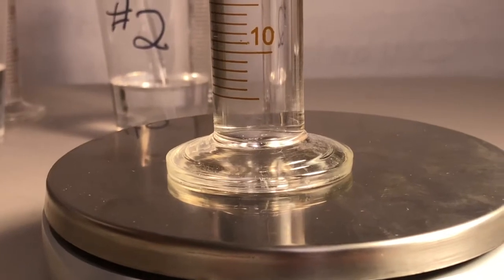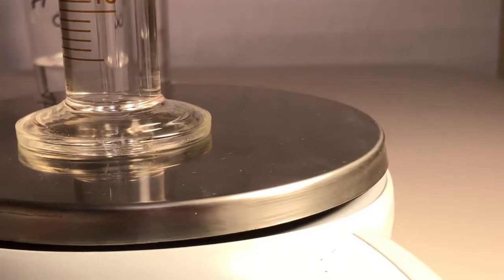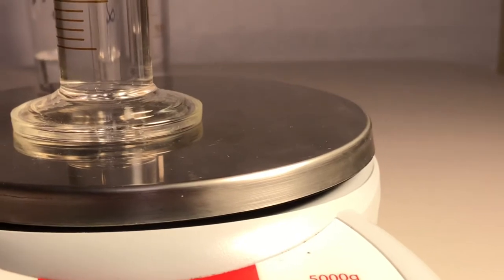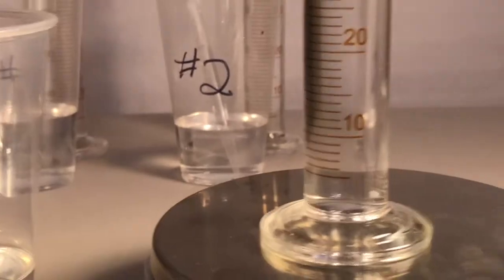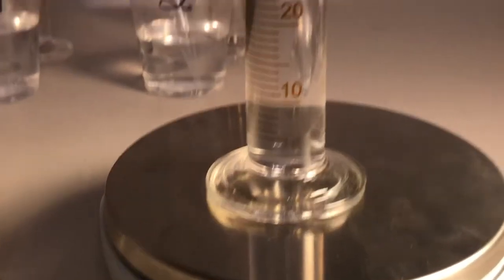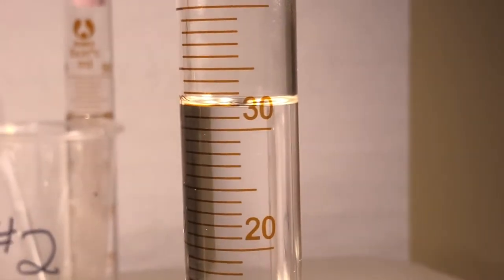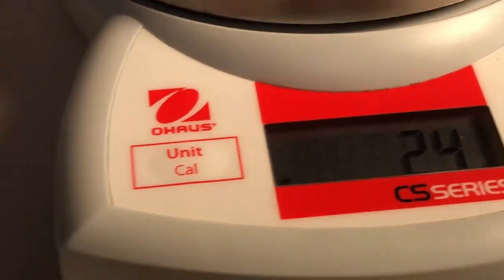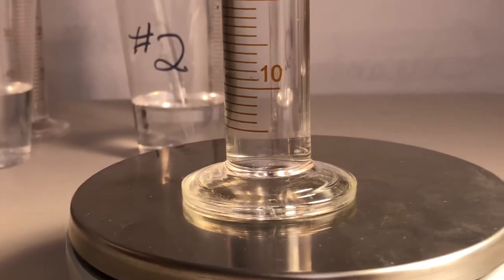That was 5. Here comes 6. Let's do a big jump. All right, that's a jump. That's a 6 jump. And let's get that right on there. What do you see? Call it. Dare to be dumb. Here's the mass. Here comes 7, right? So just 2 more.